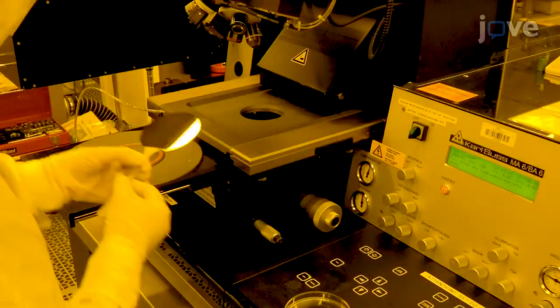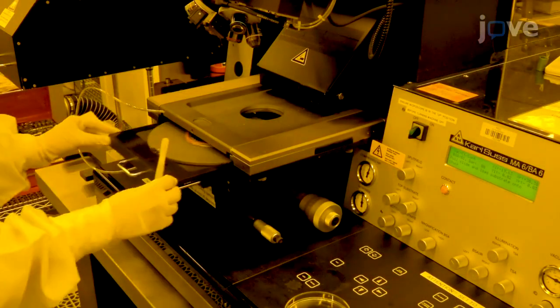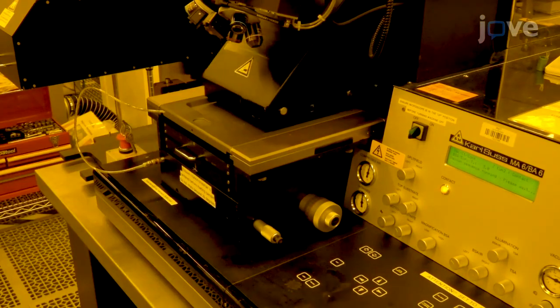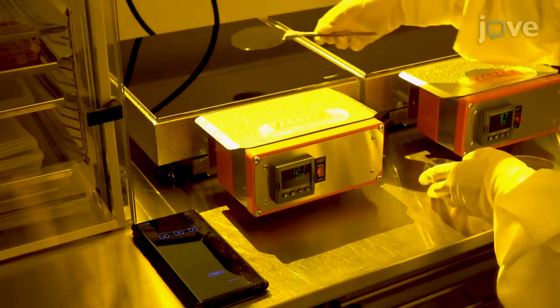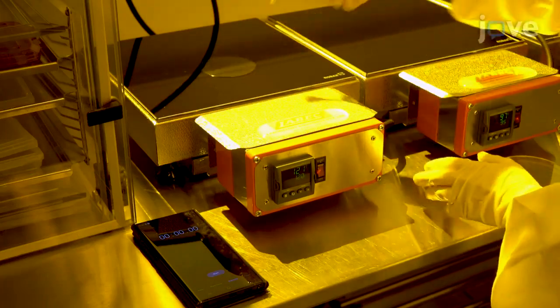Next use a 405 nanometer laser to expose the device to 25 millijoules per square centimeter and bake at 120 degrees Celsius for 120 seconds.